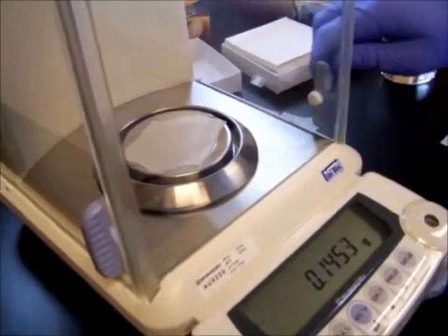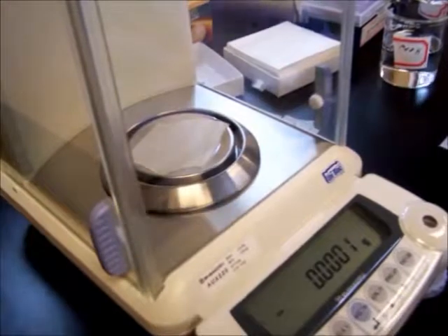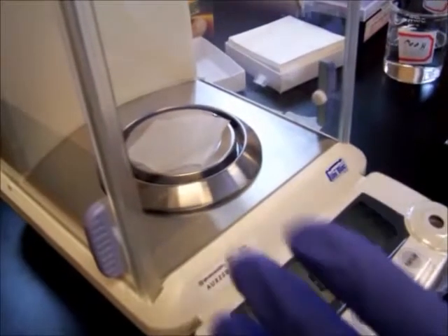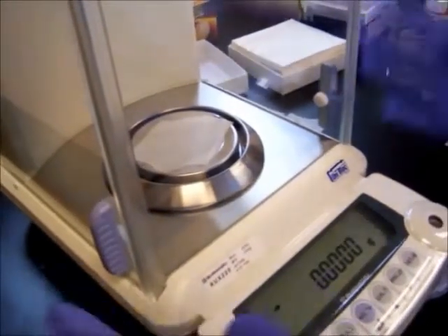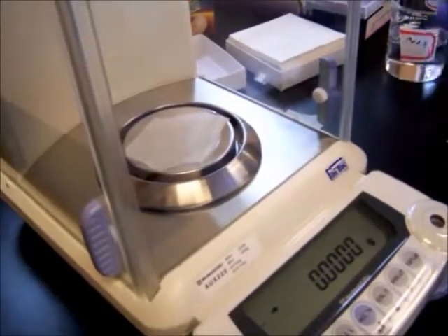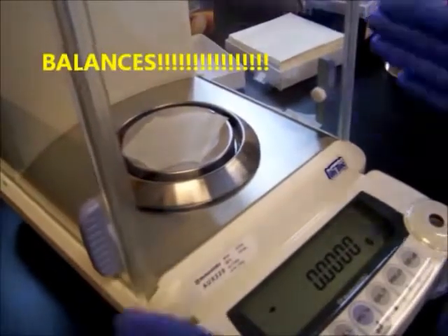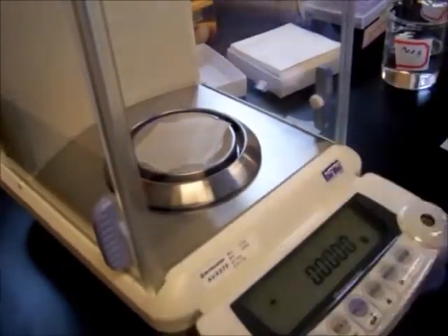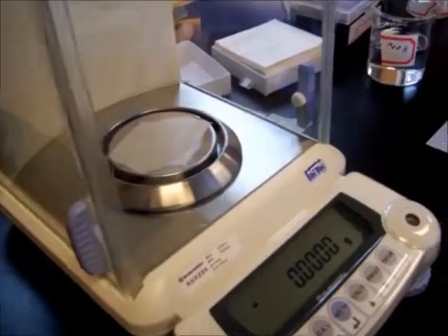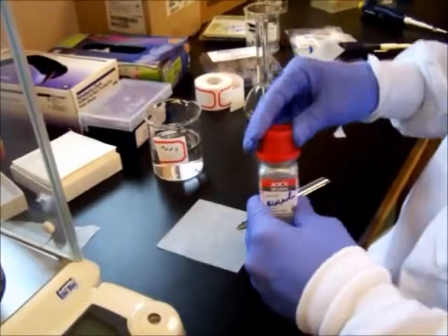Okay. Tare the scale. Now again, when working with the LCMS, we want to keep everything consistent, so only use this particular scale for anything that goes in the machine. That way we can keep track of how everything was measured. Don't use the scales in the other room, only use this particular scale. Okay, come over here. Open our container.